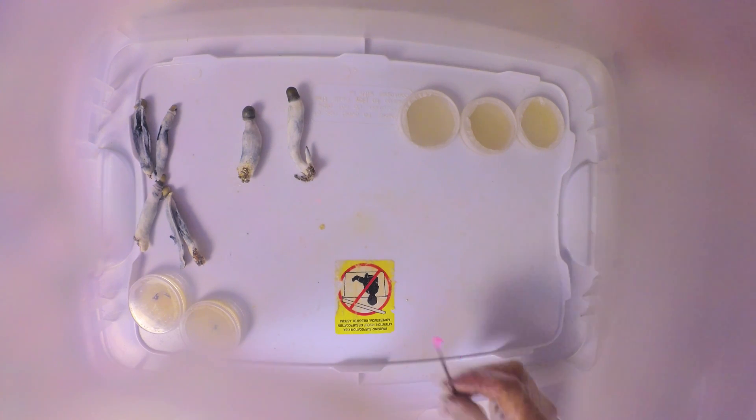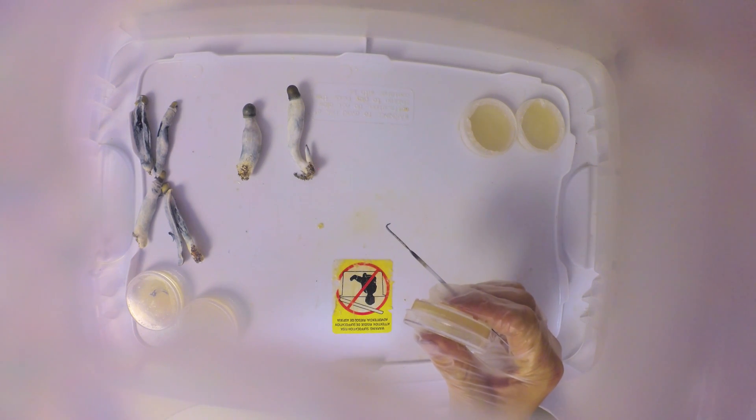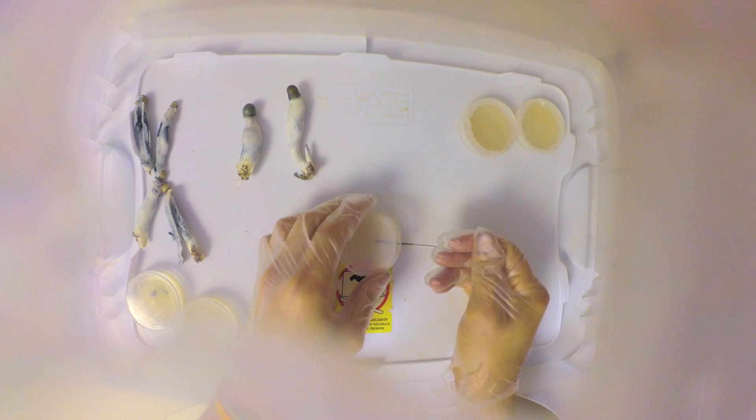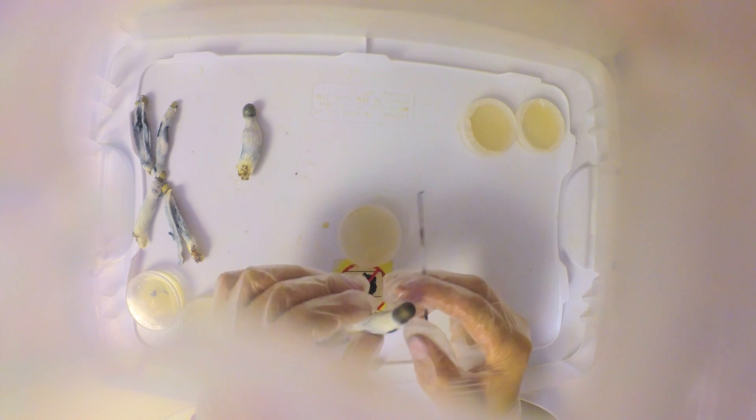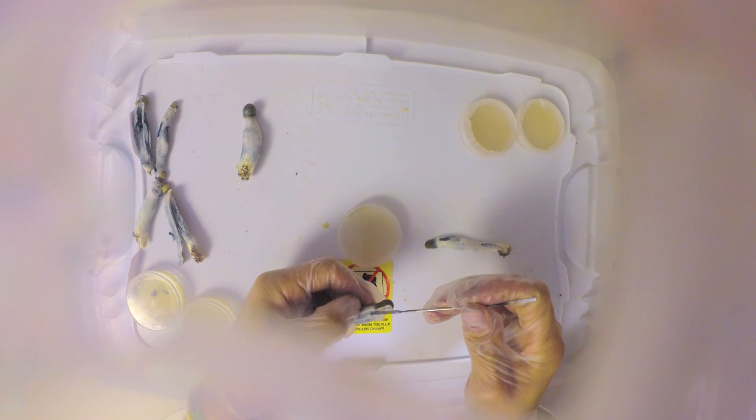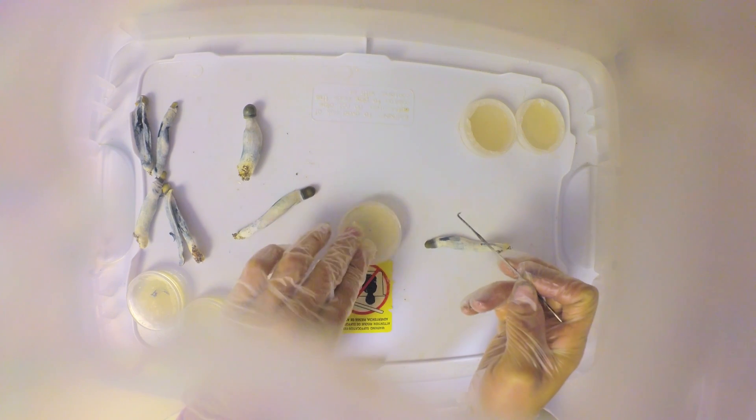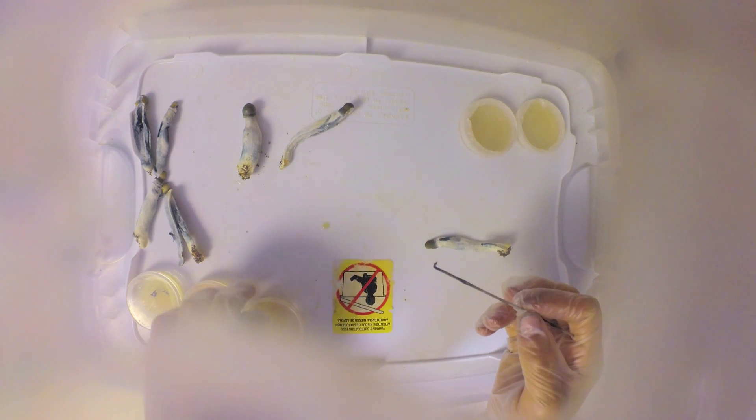I'm going to take two samples from one of these mushrooms. Flame sterilize, cool this out, and then open up your mushroom. You don't need much, you just need enough for the genetics to take hold.